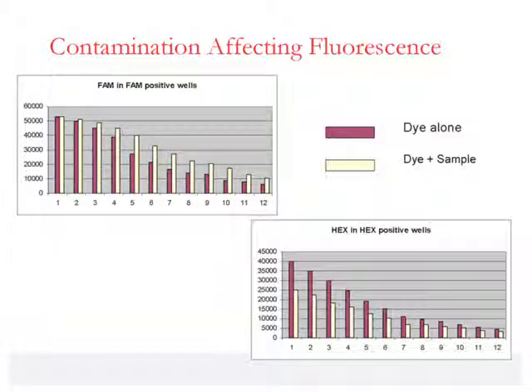primarily the HEX assay. So in a comparison of the effect of the heme with either FAM dye or HEX dye, you can see, by comparing the fluorescence signal from a dilution of dye in the presence or absence of the sample, that the effect of the sample on the FAM signal is to enhance the fluorescence, whereas the effect of the sample, presumably the heme, on the HEX dye is to suppress the signal. So in this example, we can see that the inhibitor effect is actually an effect directly on the fluorescence signal. And of course, this means that if the FAM signal is enhanced and the HEX signal is suppressed, clearly the presence of any heme within the sample, or any other factor affecting fluorescence, is going to impact on the genotyping assay in the way that we saw on the previous slide.